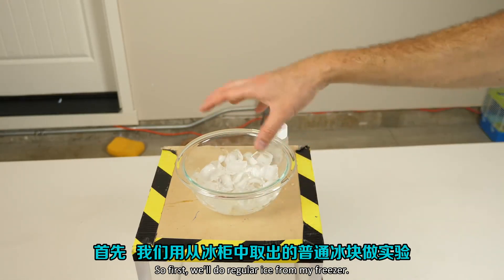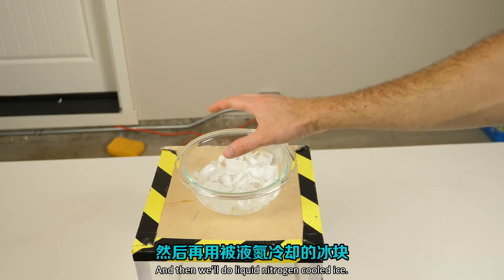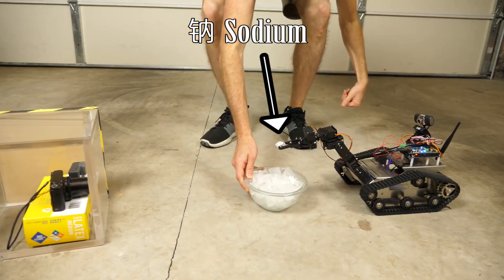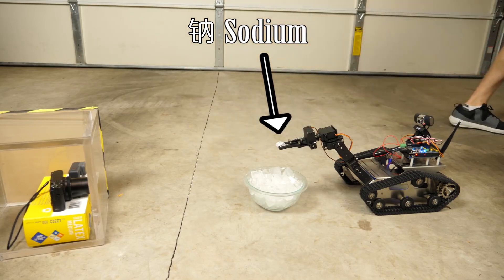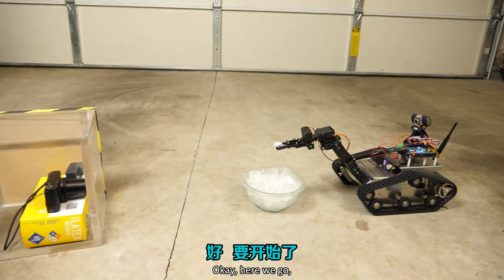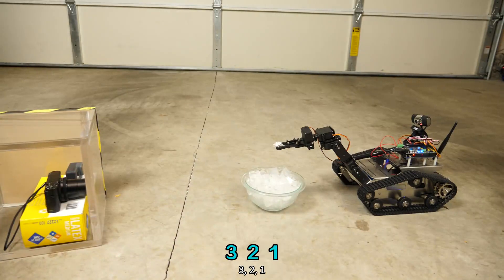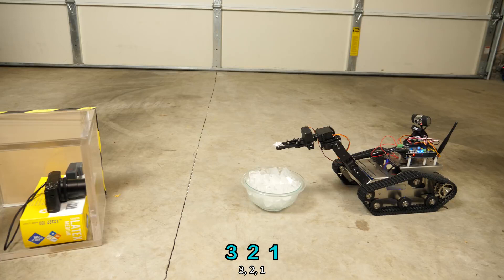There's only one way to find out. First we'll do regular ice from my freezer, then we'll do liquid nitrogen cooled ice. Three, two, one.